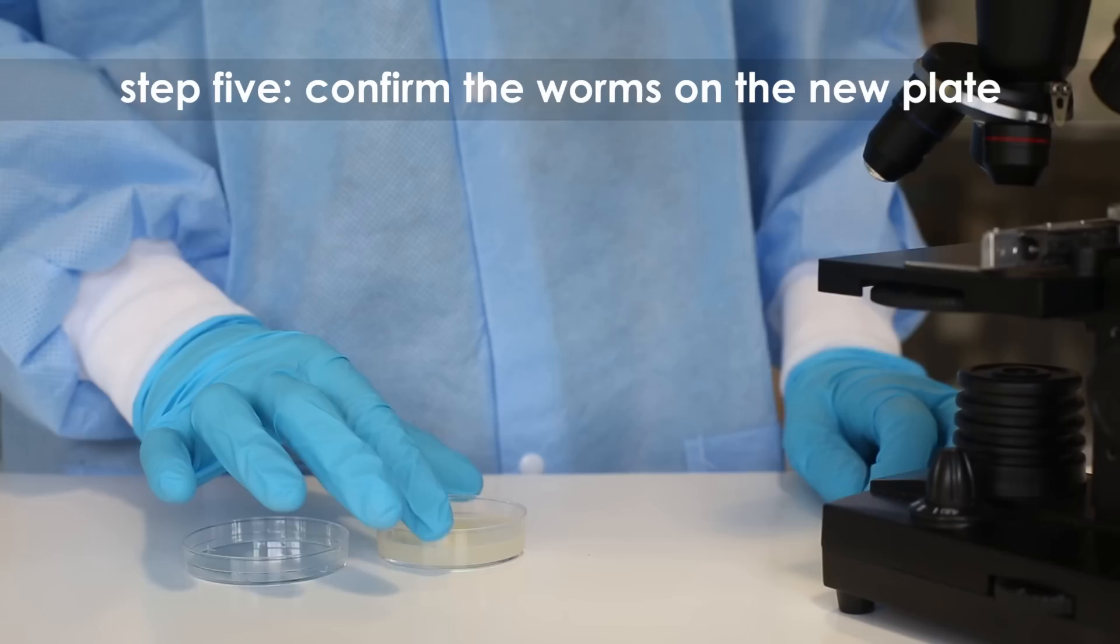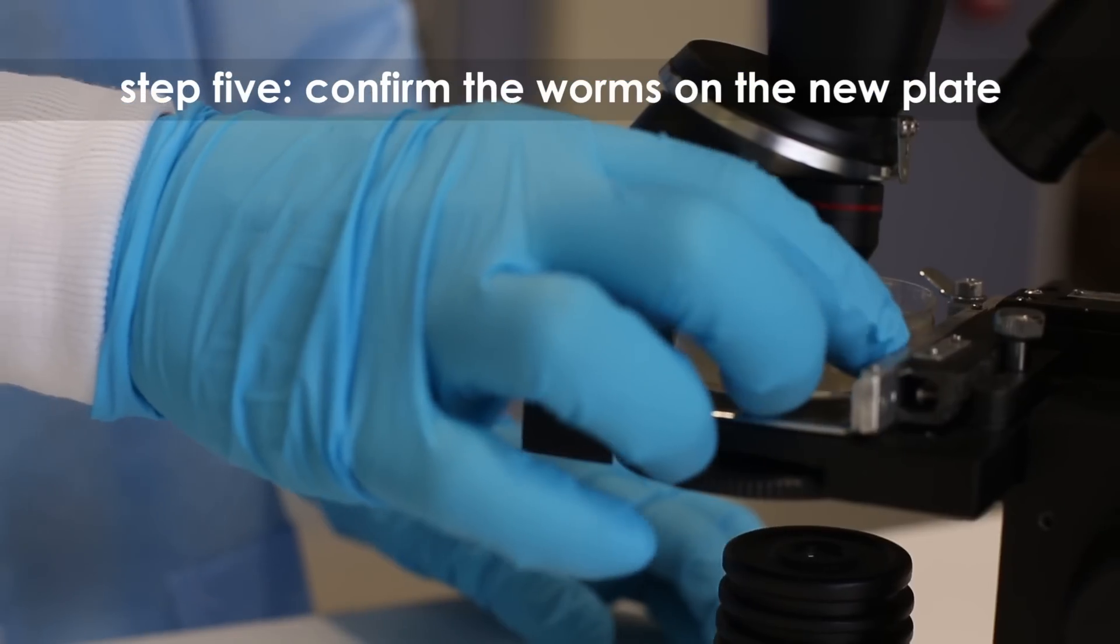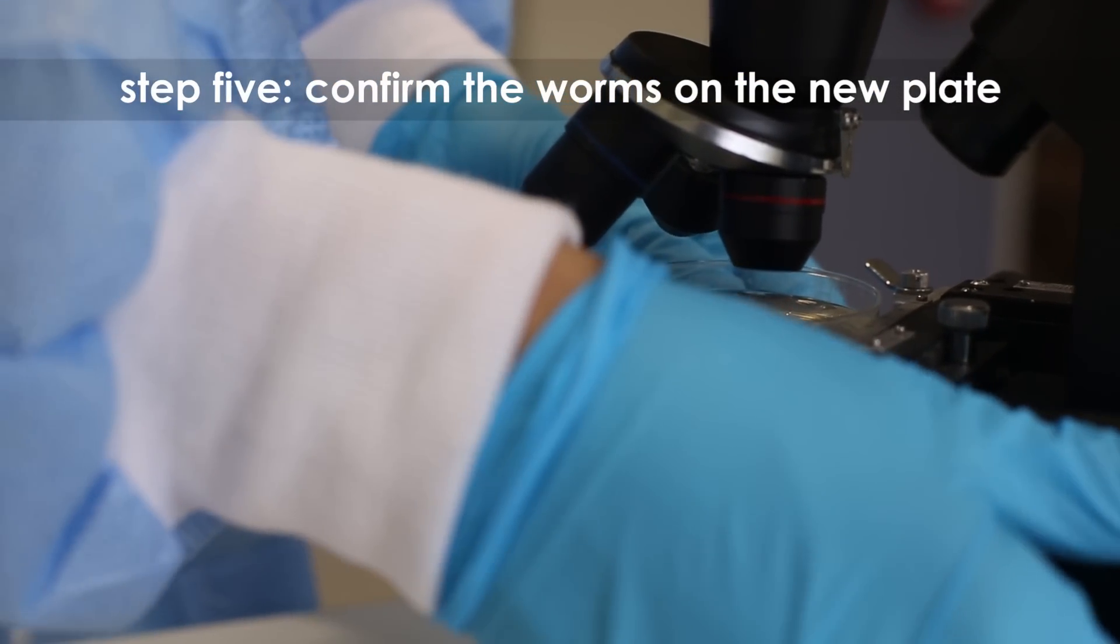Step 5: Using a microscope, confirm the presence of the worms on the new plate.